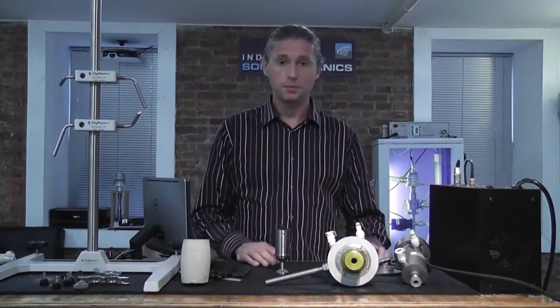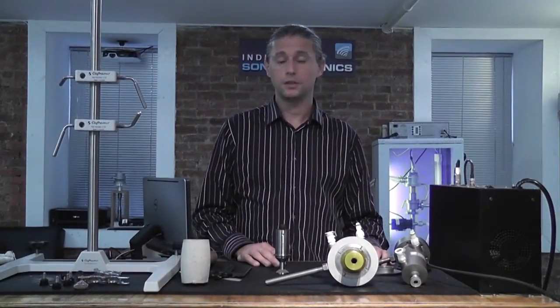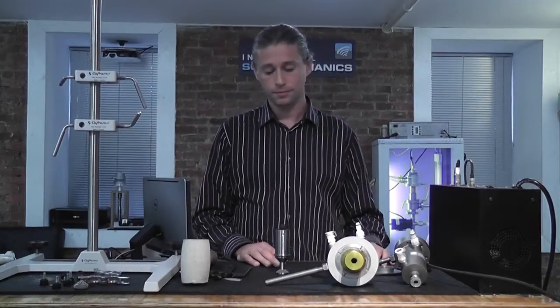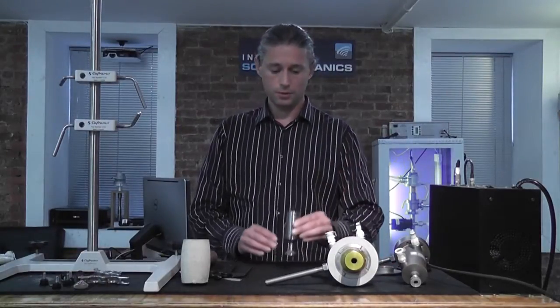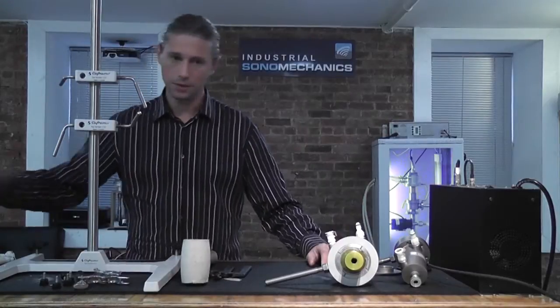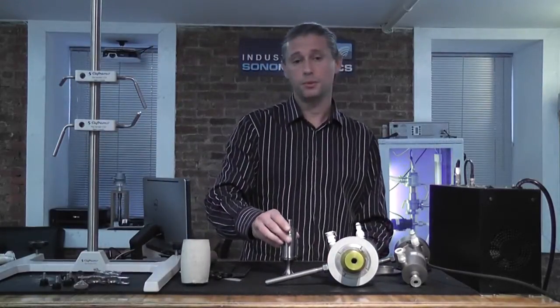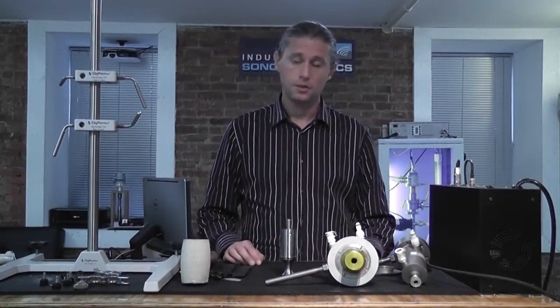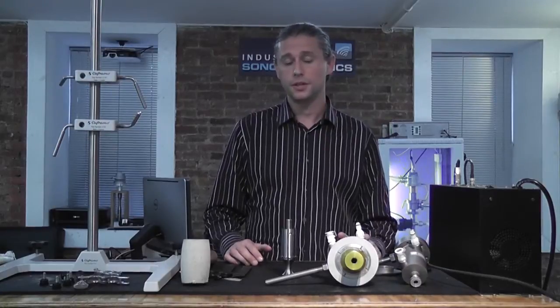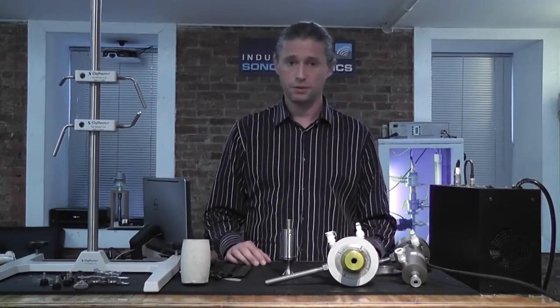At this point, the system has been disassembled and we are ready to replace the barbell horn. Instead of this barbell horn, we'll be using a different one with a different amplitude amplification factor, meaning it will provide different ultrasonic amplitudes than the one we previously used.